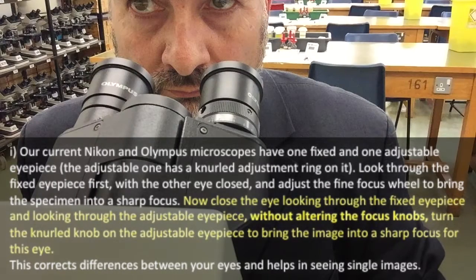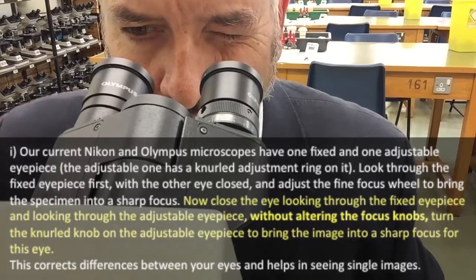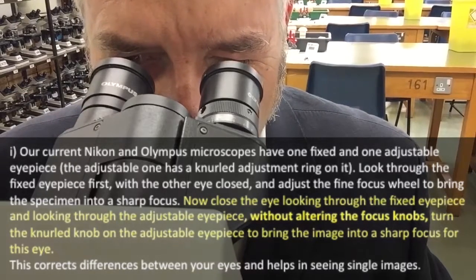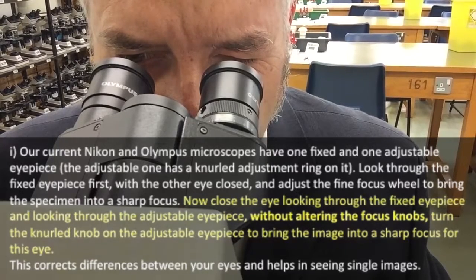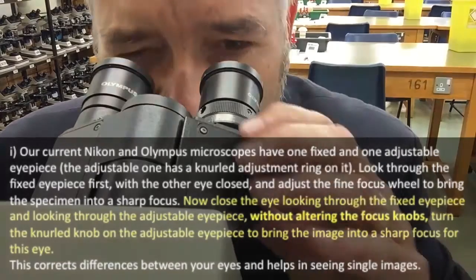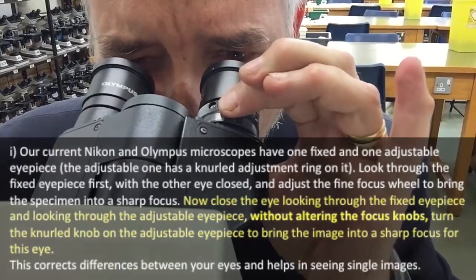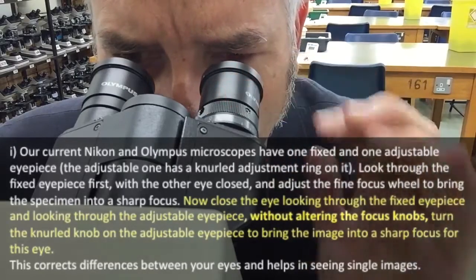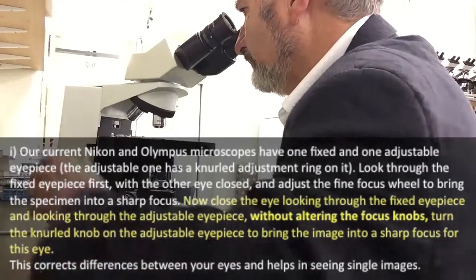We're now going to adjust the eyepieces independently to suit the different characteristics you may have for each of your eyes. First, close the eye looking through the adjustable eyepiece while leaving the other one open, and adjust the fine focusing control at the base of the microscope to bring the specimen sharply into focus for that eye. Now switch eyes — close the eye looking through the fixed eyepiece and, without changing the focus at the base of the microscope, just use the focusing ring on the other eyepiece to bring the image sharply into focus such that a sharp image is seen through both eyepieces.